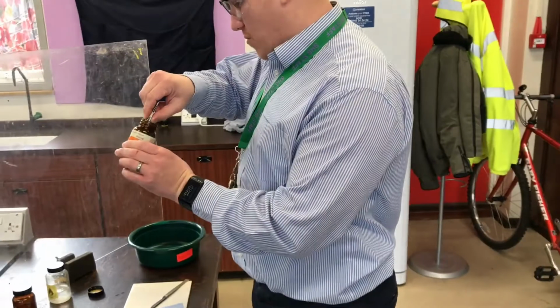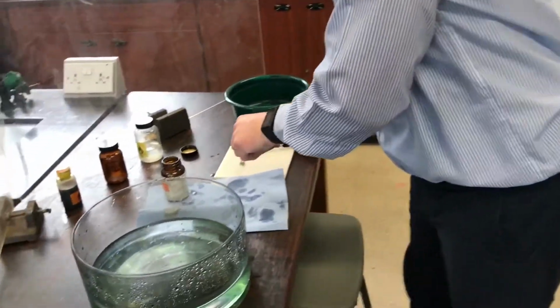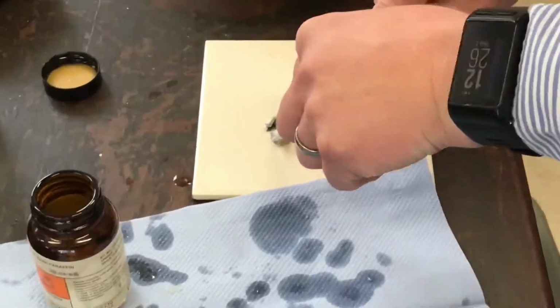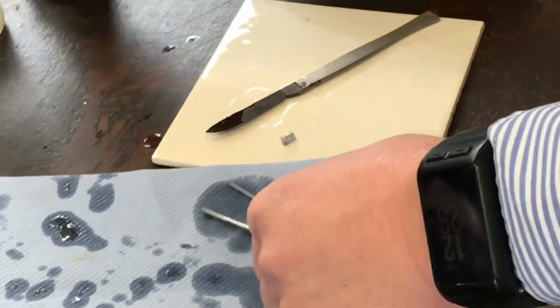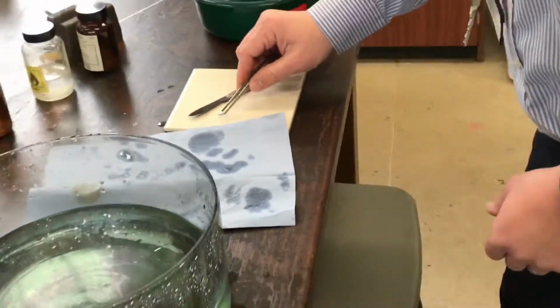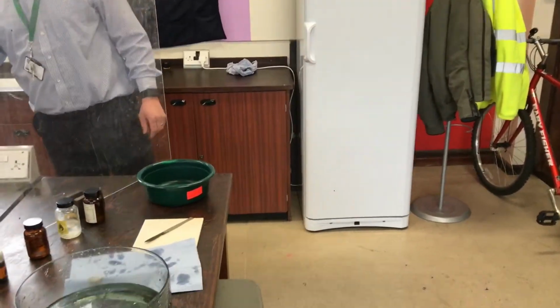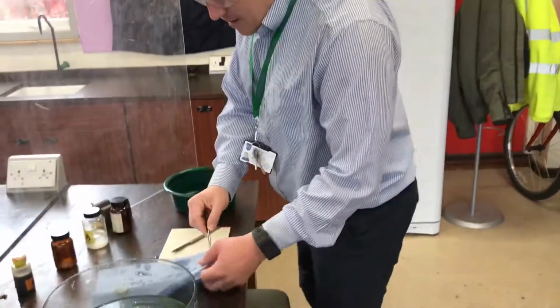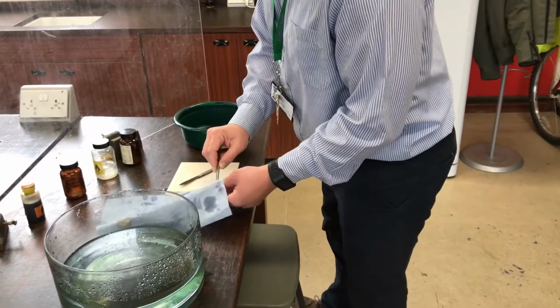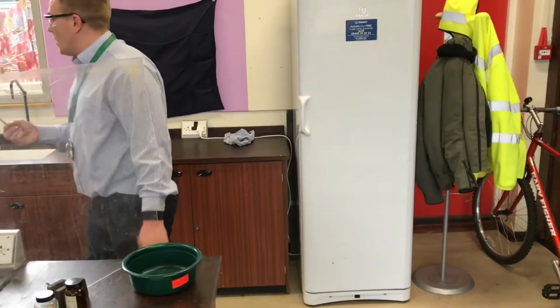But I do want to just show you what the inside looks like. If I cut a sliver, it's quite sparkly. Looks a bit like a precious stone or something you'd use as jewellery. If you have a look here, I can bring it and show you. It's got a bluey tinge to it. And as it hits the air and I dampen off the oil again, you'll notice what happens. It's even gone more blue, look.